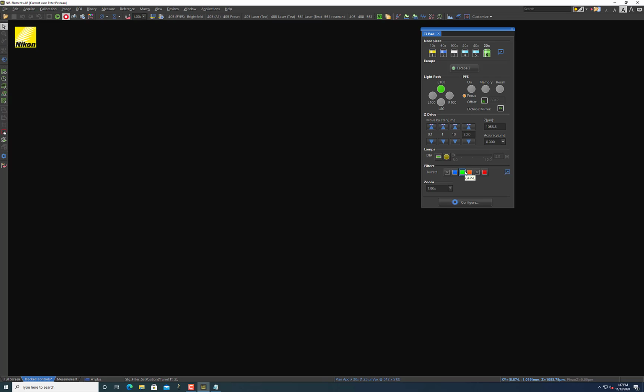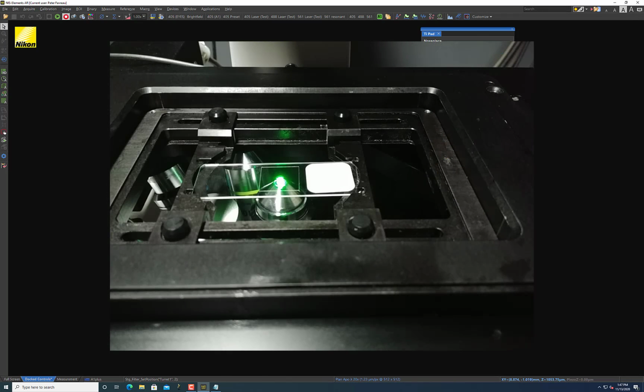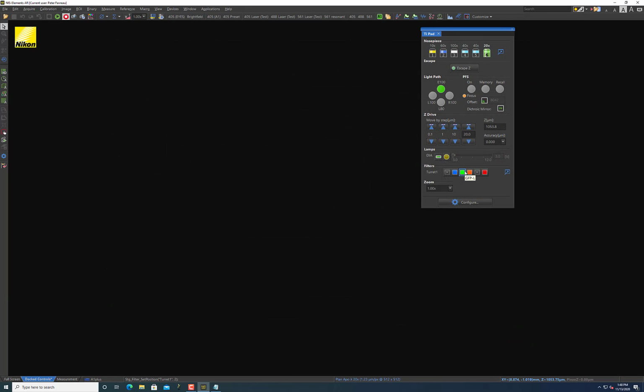But an even better indication, of course, is that when you look on the stage, you'll see that there is light coming from the objective that's corresponding to the fluorophore you're trying to excite. So in the case of GFP, I have some light coming out of the objective now that I've actually turned on the LED light source. And so from there, I wouldn't keep the light source on at all times, but I would use it sparingly to just glance into the eyepieces and then get your sample in focus that way. And as I said, it's also a very useful mechanic to quickly glance around your sample and make sure that your sample is actually expressing the fluorophore that you're interested in looking at. So that's using the LED light source.